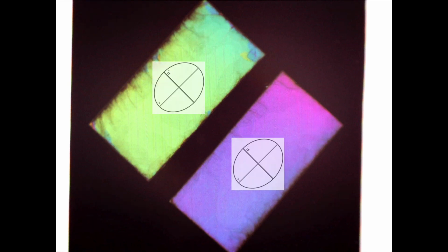We'll first superimpose onto our plates an image of our refractive indices in this plane. Our larger refractive index gamma is associated with the longer direction of our oriented Muscovite plates, and if these were natural mineral growth patterns, we would refer to these as length slow, meaning that the longer direction of our crystal is associated with our larger refractive index, and therefore light traveling along our crystal in this direction will be slower, giving rise to the terminology length slow.